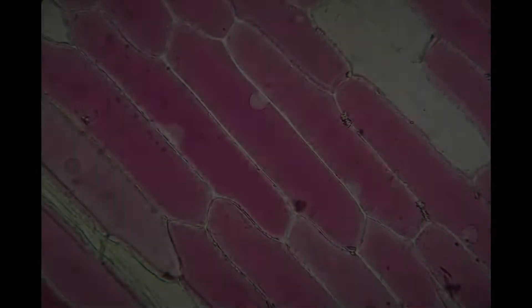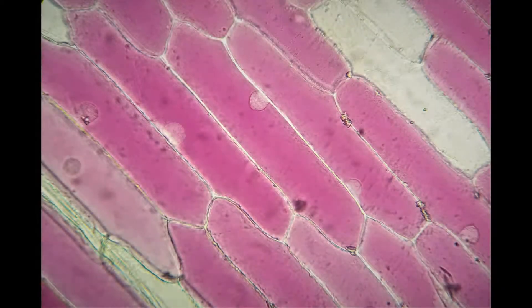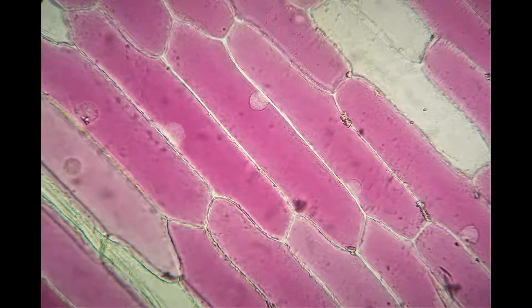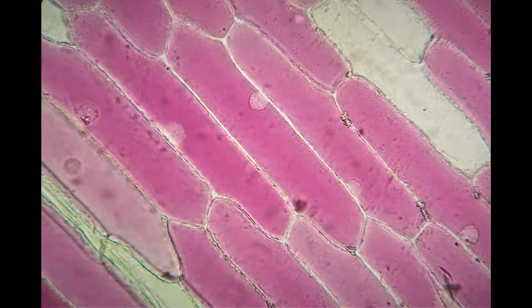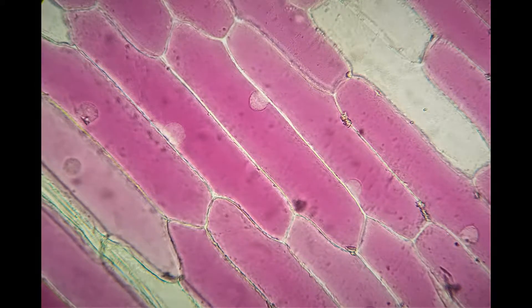In this experiment, we'll be demonstrating the phenomenon of plasmolysis and deplasmolysis in plant cells using onion epidermal cells as our material.